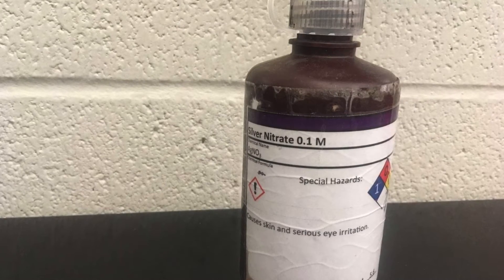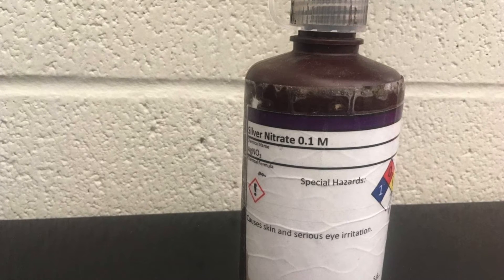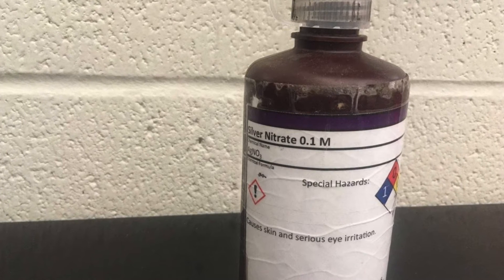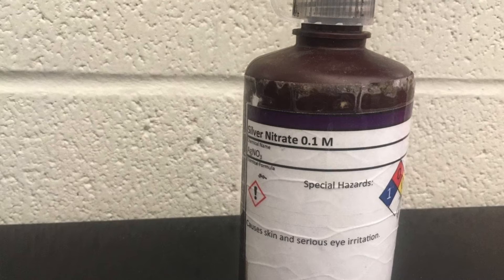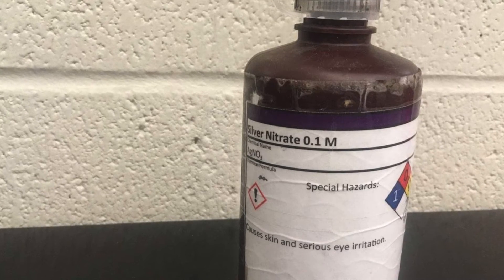In test 4 you'll be using silver nitrate which can stain your skin so be careful when using it. This reaction also takes several minutes so be patient and record your observations while you're waiting.